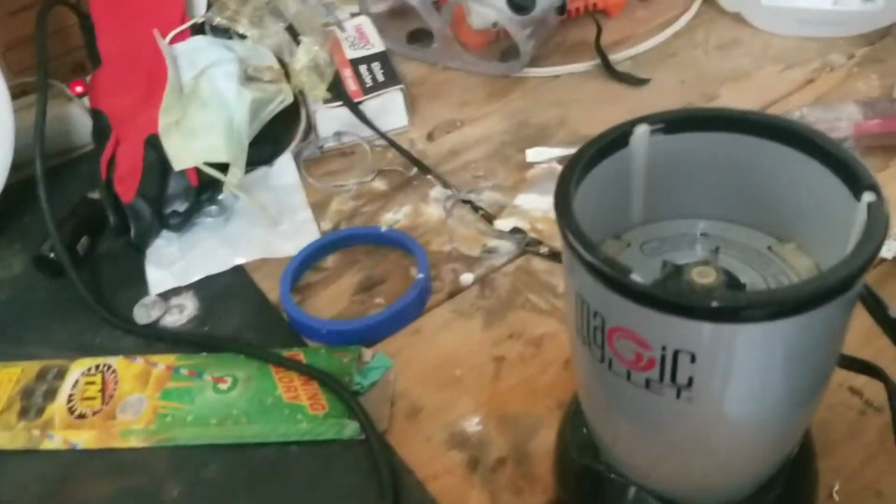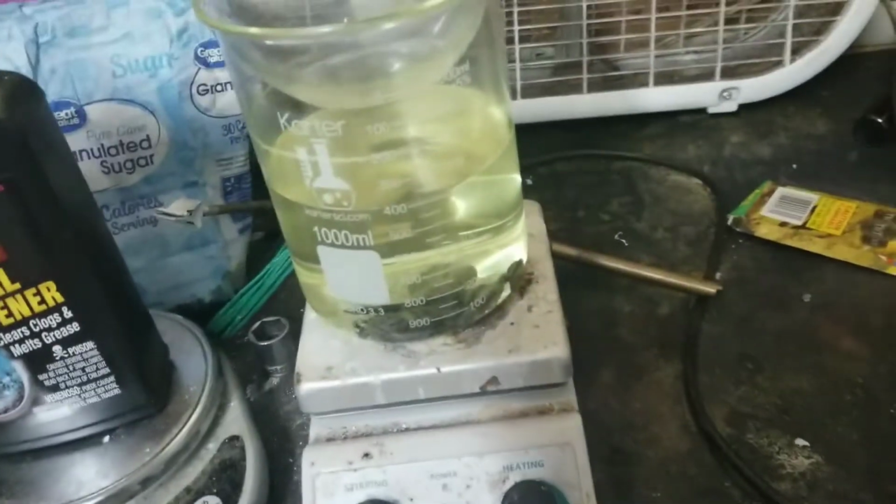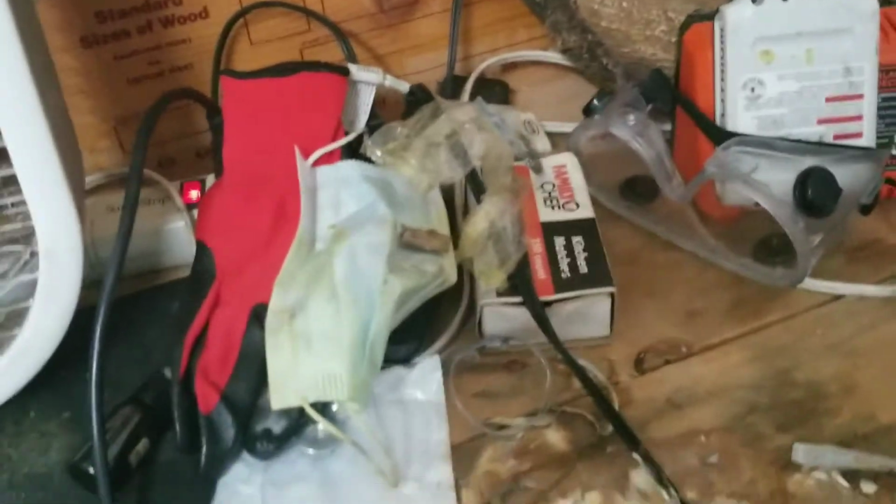was just covered in hydrochloric acid. And you can see some corroded stuff. This is some of my magnesium that got doused in it. It's all corroded. So I had to refill it. So that's all our progress reset. And you can see just everything is corroded.